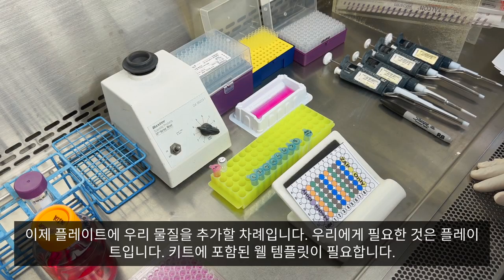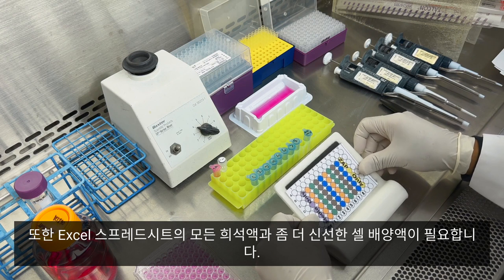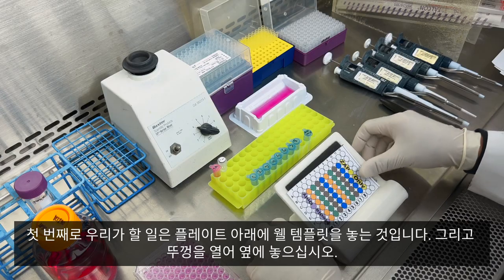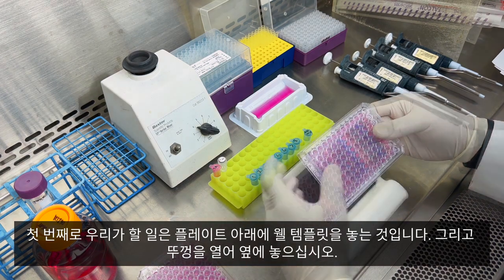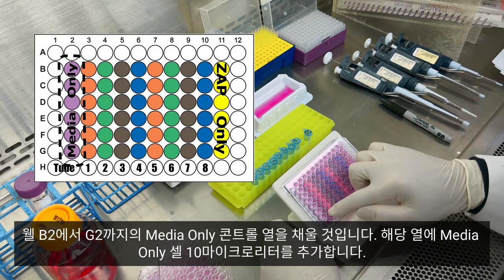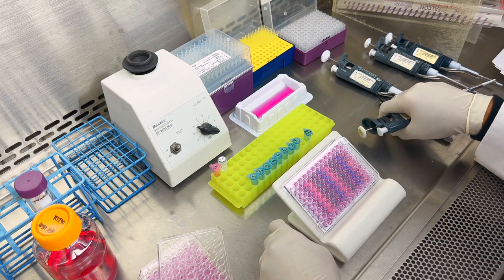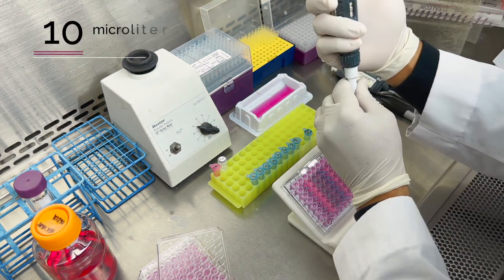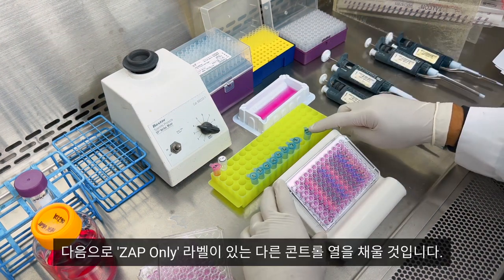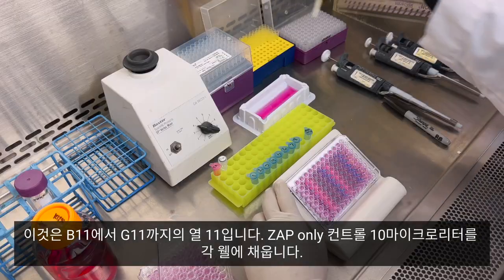Now it's time to add our material to the plates. We need our plates and the well template that comes in the kit, along with all our dilutions from the Excel spreadsheet and some more fresh cell media. Place the well template underneath the plate and remove the lid. We're going to add to the media only control column — wells B2 through G2 — adding 10 microliters of cell media only. Next we will add to the zap only control column, which is column 11, wells B11 through G11, adding 10 microliters of the zap only control to each well.